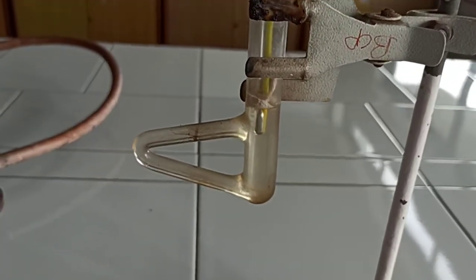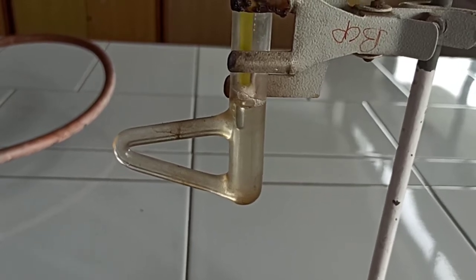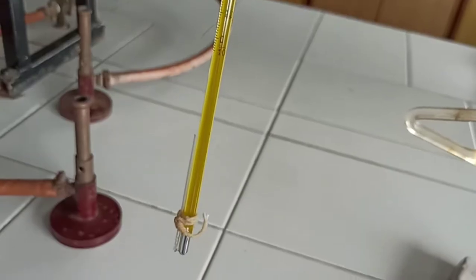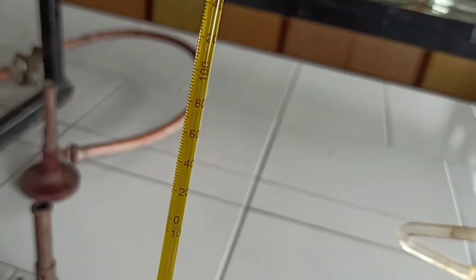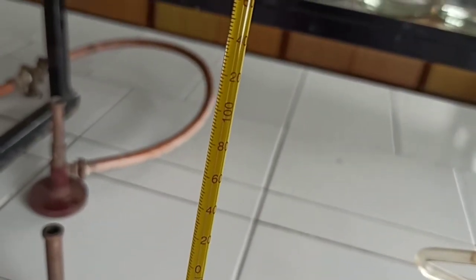See the melting point, it starts to melt. See, our substance gets melt at 121 degrees Celsius. See the mercury.